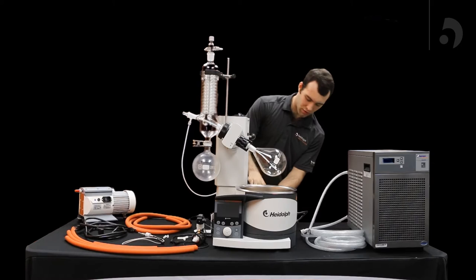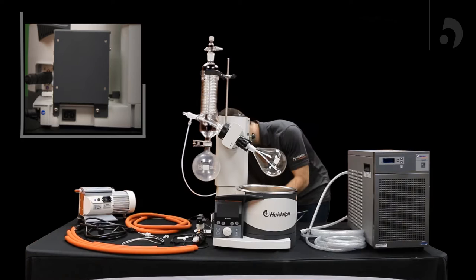This is going to sit right in the back over these two lines right here, and using a torque screwdriver, you just screw that in.